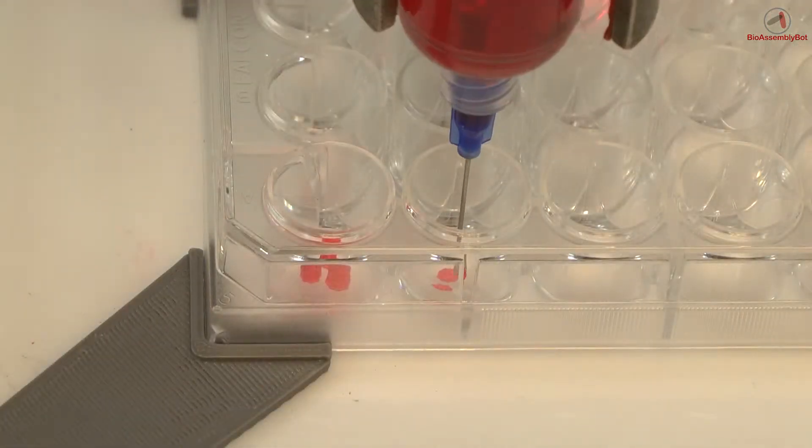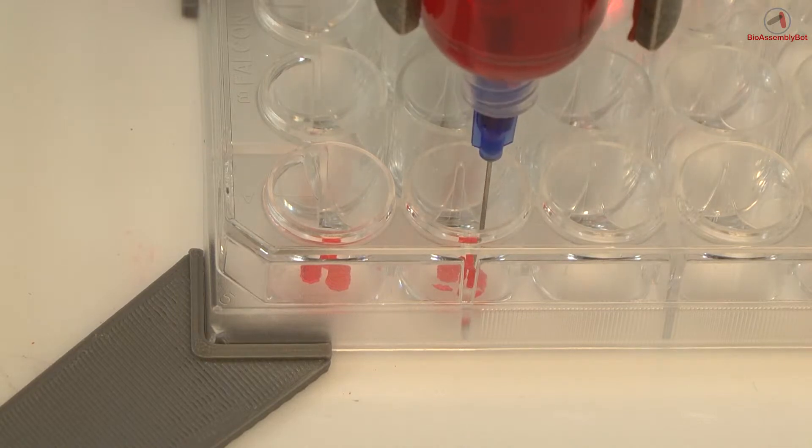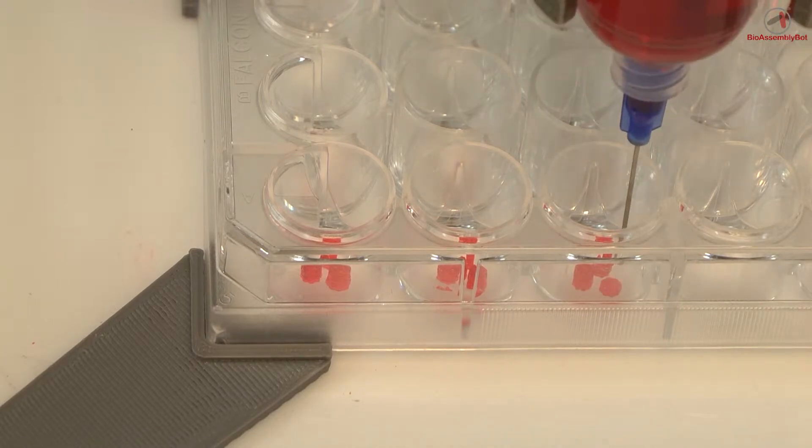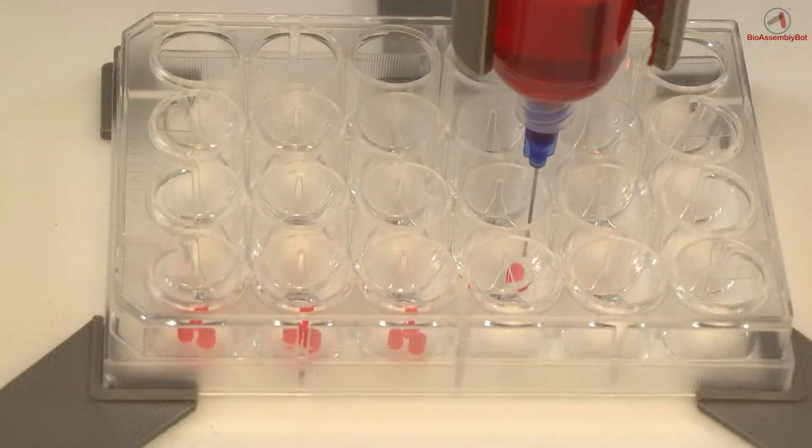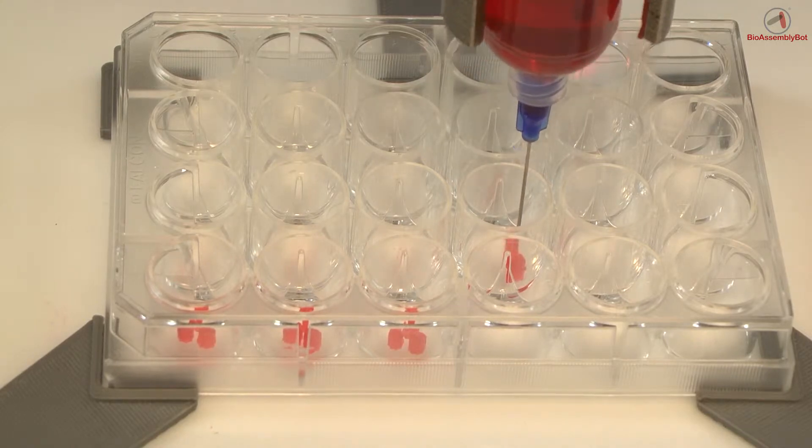Of course, it's possible to fill in around that either with specific culture media, matrices, or even additional different cell compartments. This is shown being done in multiple wells at different locations in the plate.